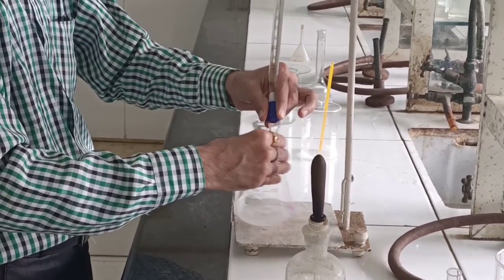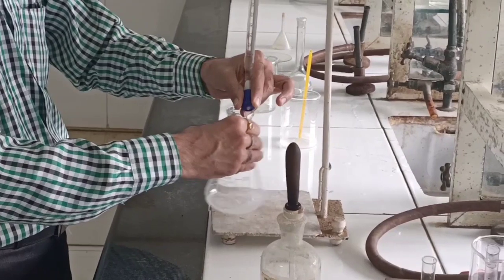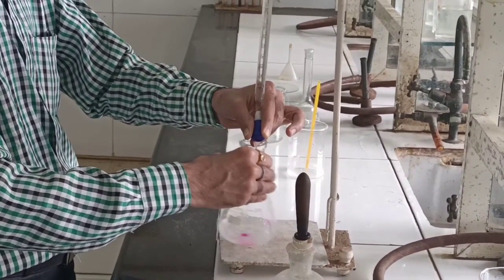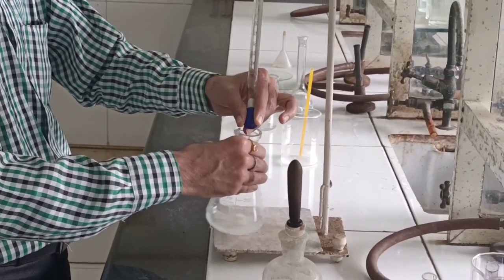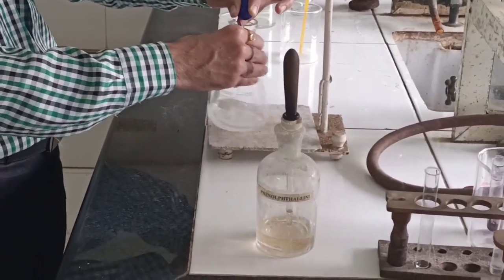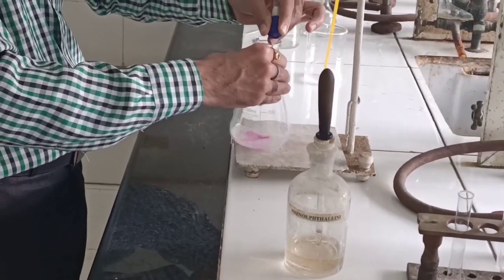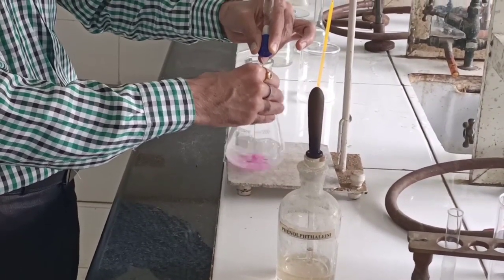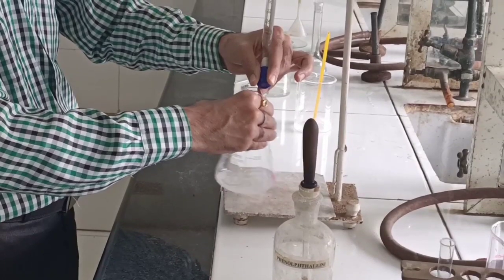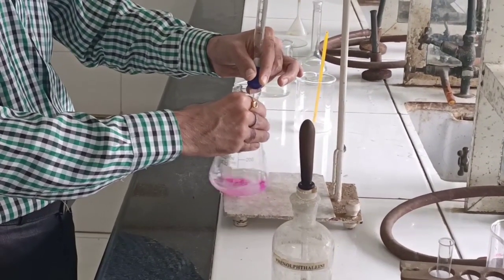Drop by drop, we will be adding NaOH. Even after shaking, the pink color should sustain — that will be our correct reading. Very slowly, drop by drop, we are going to make sure the addition takes place and the conical flask is continuously stirred. You can see the pink color does develop at the point of contact, but on shaking the conical flask it disappears. We need to continue till a permanent pink color is obtained.